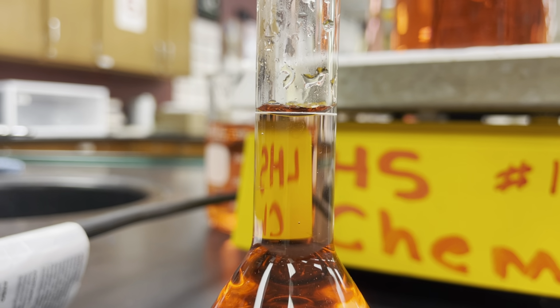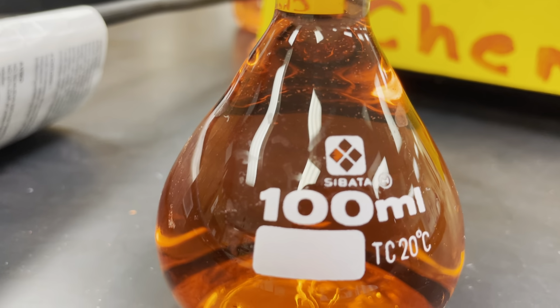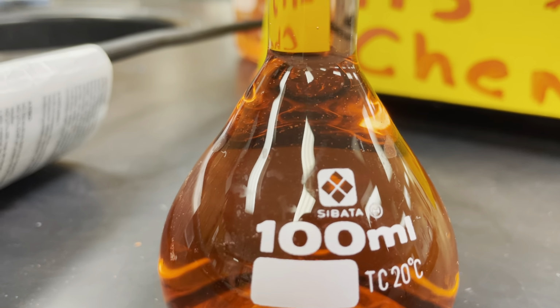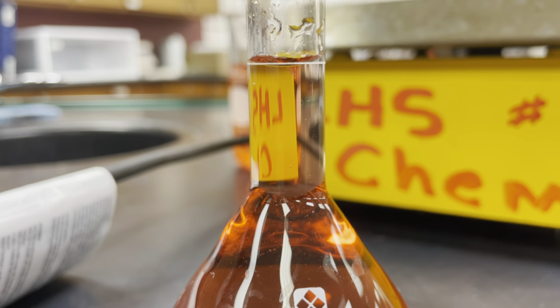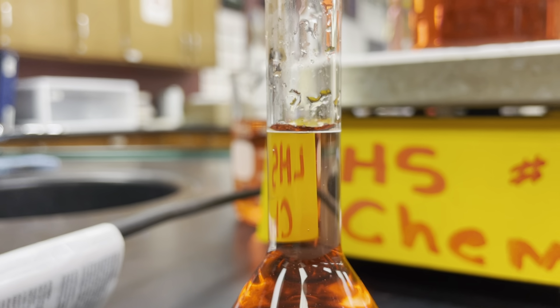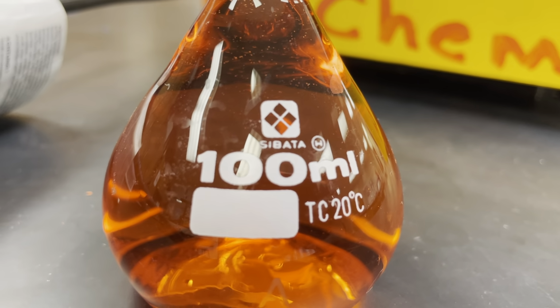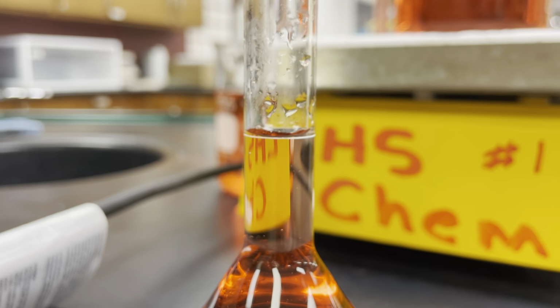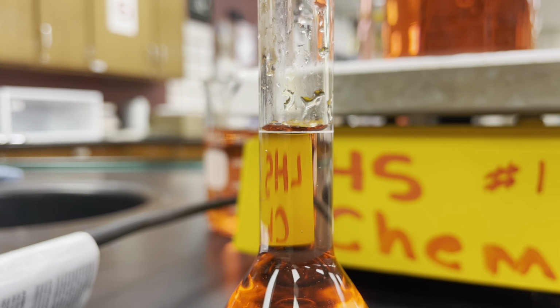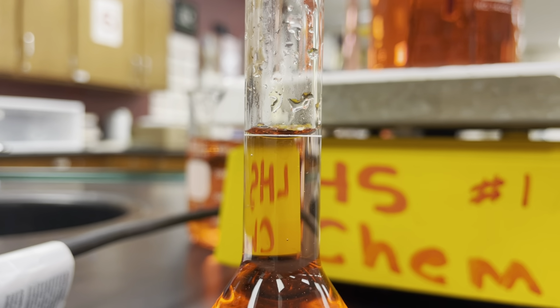Now, like with any measurement, there has to be some level of uncertainty that we don't know. But since we don't have extra marks on here, we can't just say, well, I can see the ones place, so I can go to the tenths place, or I can see the tenths place, so I'm going to the hundredths place, and we just go one spot past what we do know. In this case, you just have to kind of know that you need 2 decimal places out from whatever you're measuring. So if this is a 100 milliliter volumetric flask, we can say that this has exactly 100.00 milliliters of liquid volume in here.